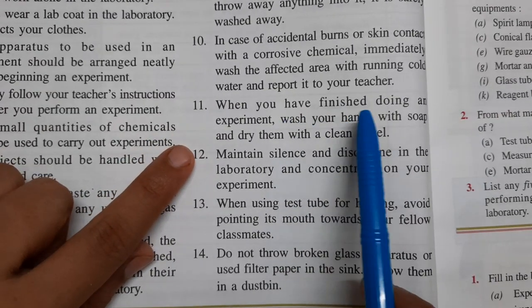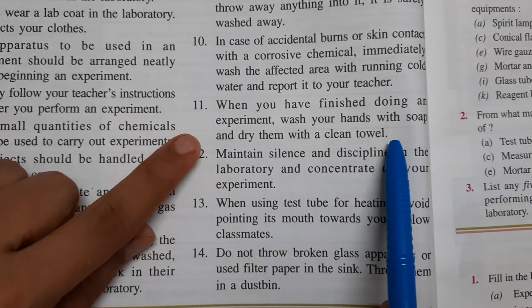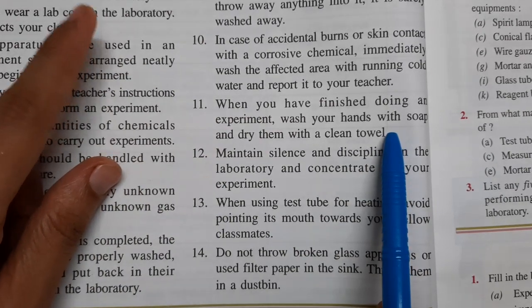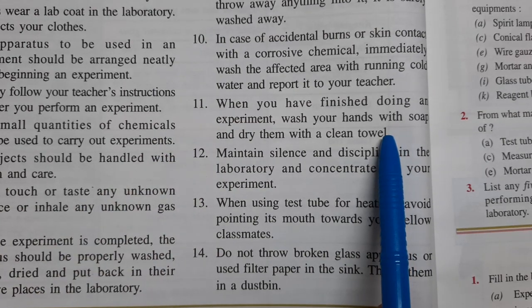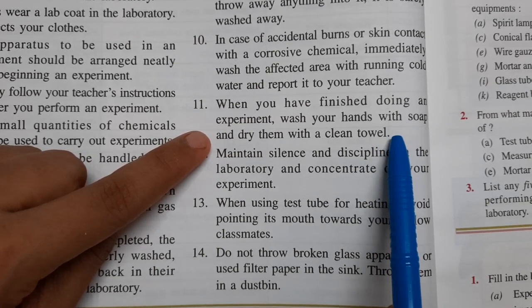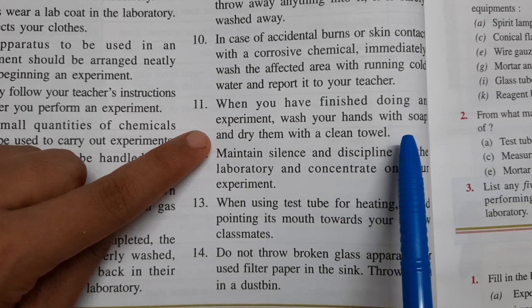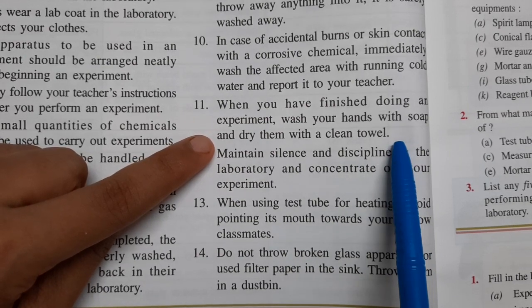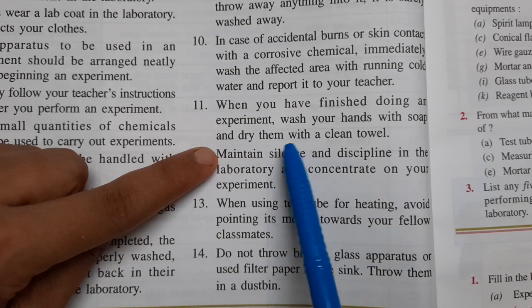Next: when you have finished doing an experiment, wash your hands with soap and dry them with a clean towel. When you are wearing a lab coat in the lab, always keep a small towel or handkerchief in your lab coat pocket. After finishing the experiment, wash your hands with soap and dry them with that clean towel.